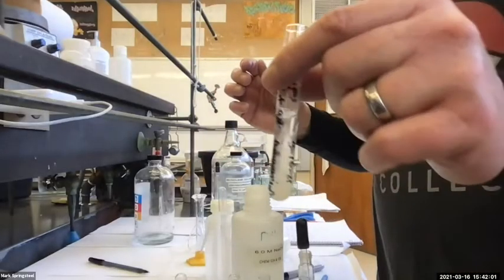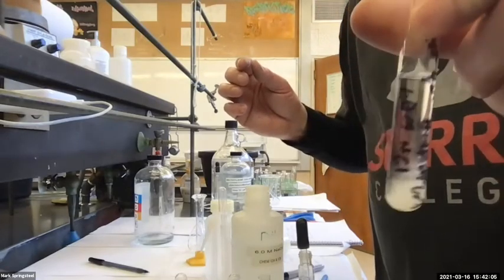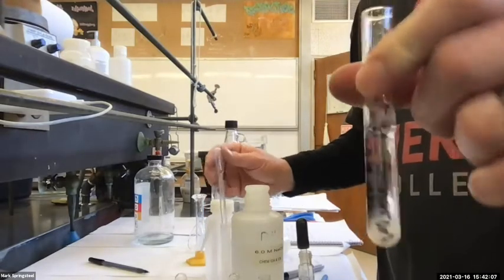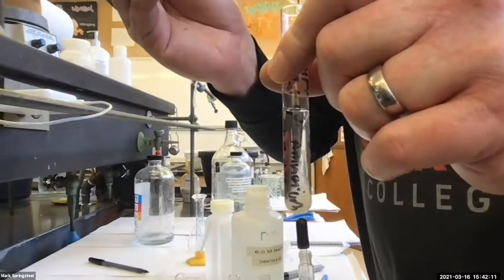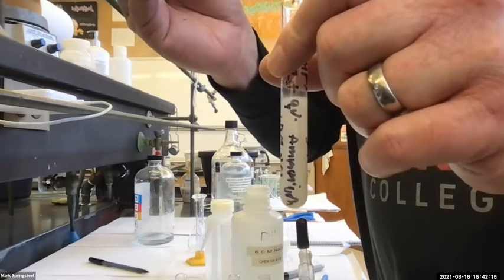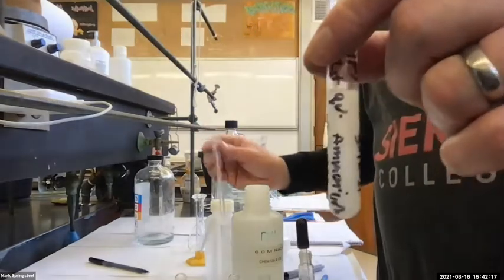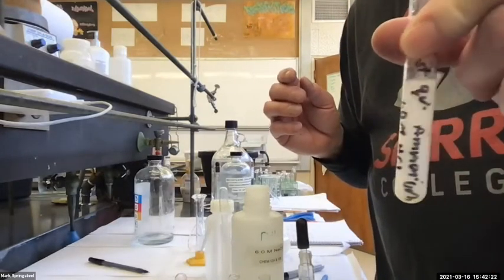Ooh, the precipitate's not going away now, huh? Well, maybe it is. I'm getting close. I'm basically doing a titration, taking this acidic solution toward the midpoint, and then past the midpoint to the endpoint. Let's see if we go past the equivalence point, and oh, look at that! It's almost all white solid now, huh? What's that white stuff?